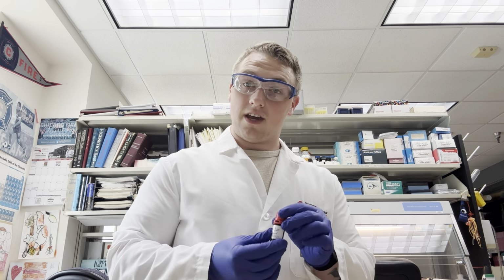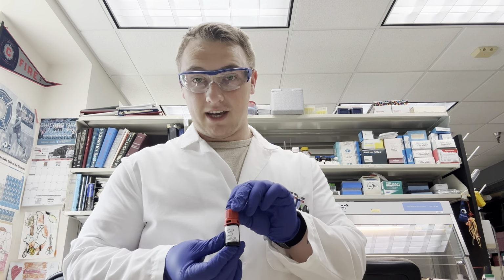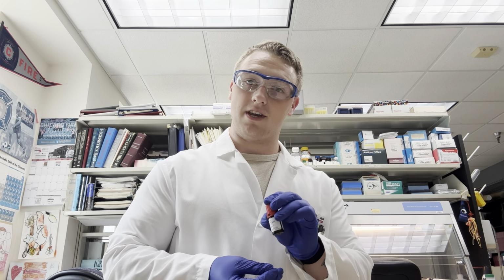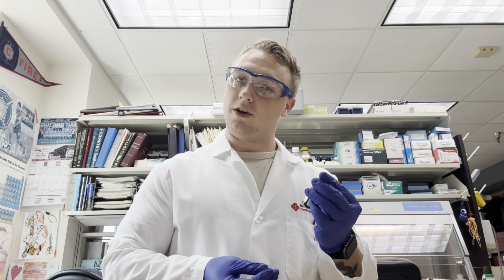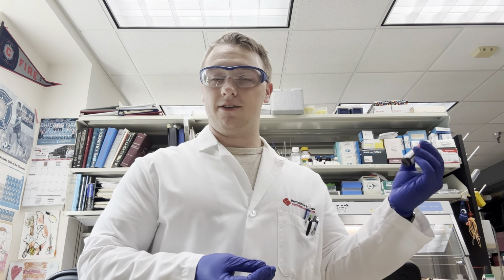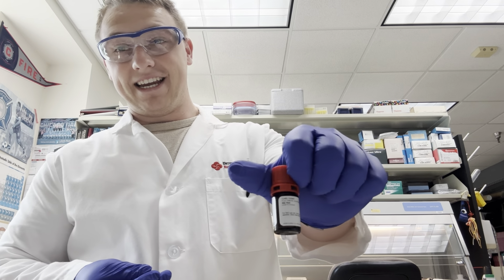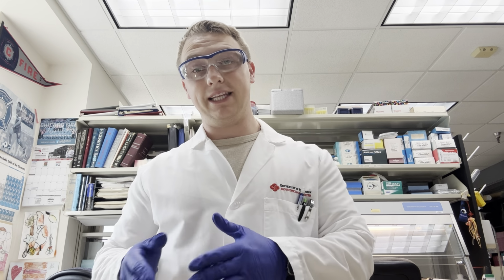So today, this sample is not going through the LC. This is for a different experiment, but it is still going to use the same principles of dilution, and we are still going to go through it in the same way we would with any LCMS sample that we would submit. So this is a Nile red dye for a different experiment, and we are going to be diluting it down to a 1 milligram per milliliter concentration to get into a working concentration for a future experiment. But the process is, again, the same. So let's get right into it.